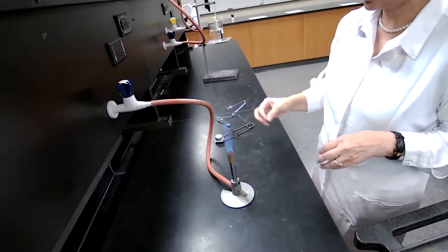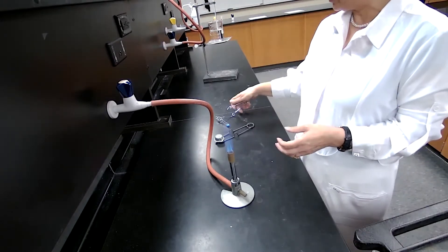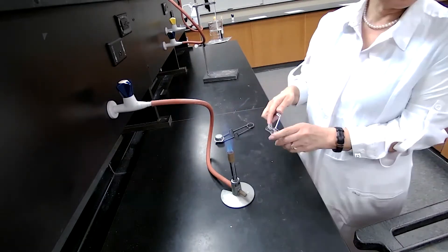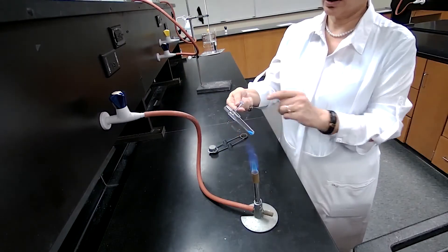This is part of the experiment to teach you a technique, also how to heat a test tube directly on the flame. Make sure you use a test tube holder.